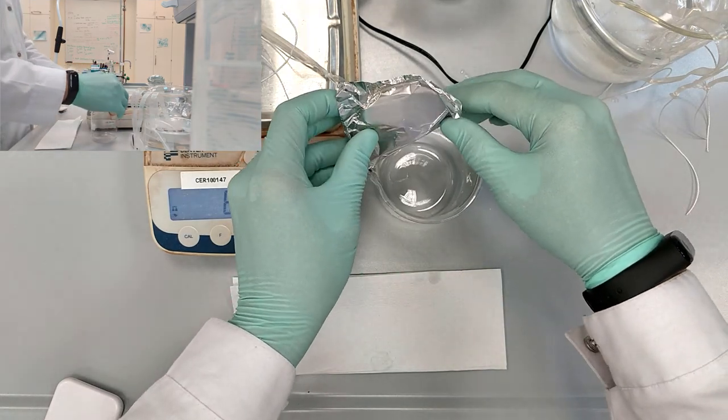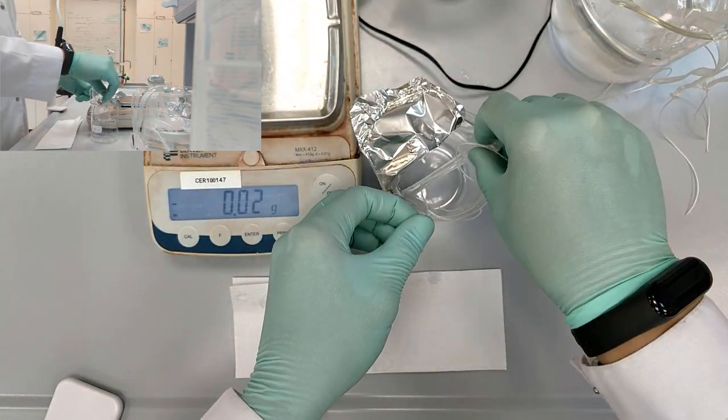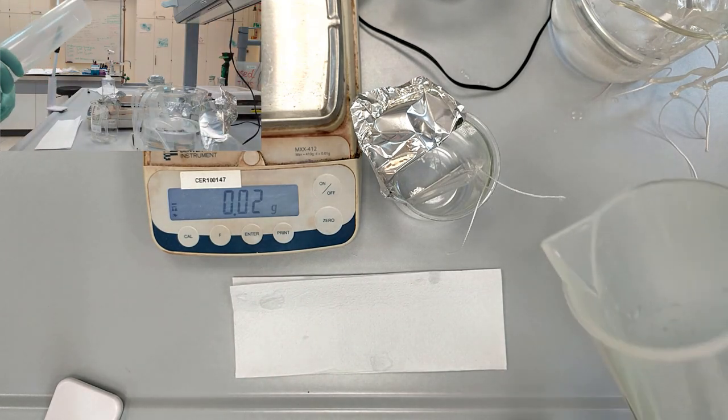Label the beaker and place the tube inside. And as in previous examples pour 200 ml of water.